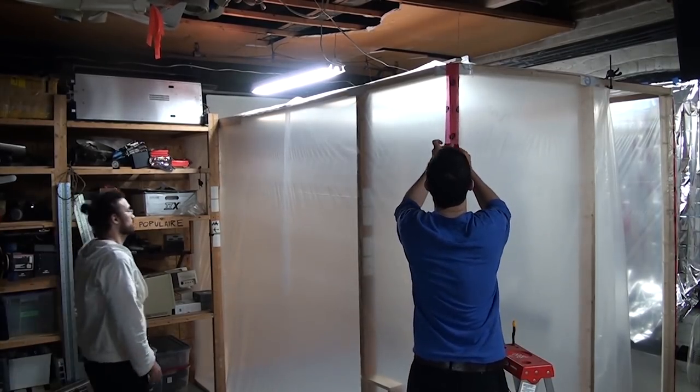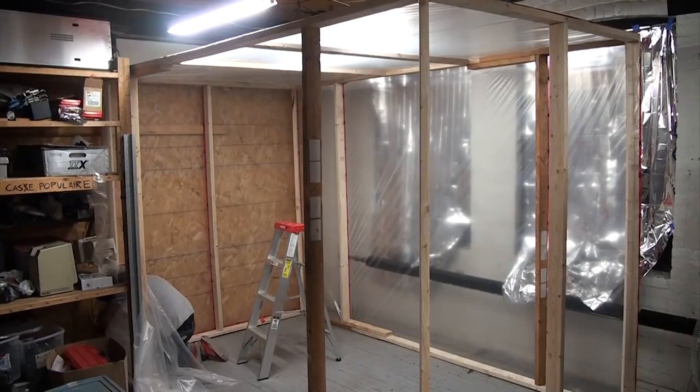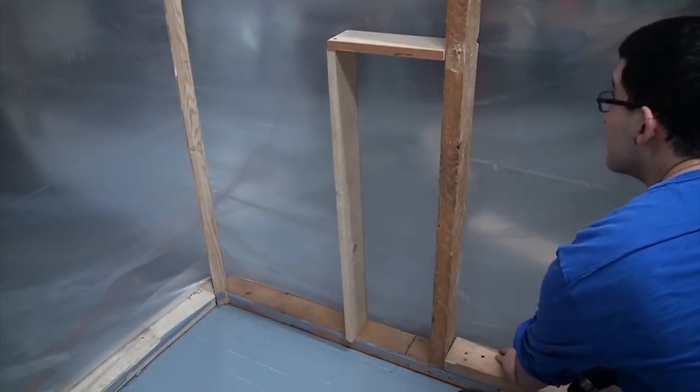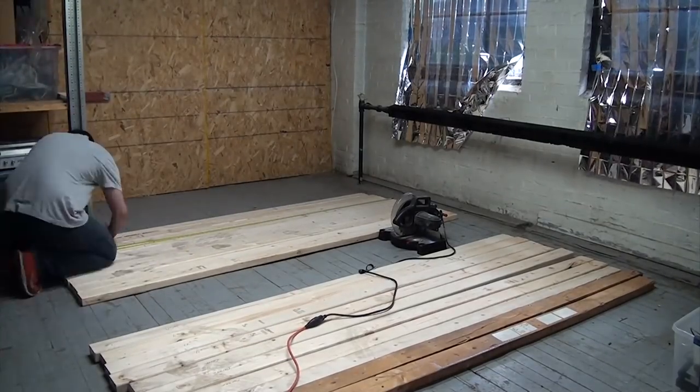However, we aren't going to build this in the standard way that you would, say, frame a house. Because we need to affix plastic to both sides, we need flat surfaces to attach the plastic to. So where the corners of the walls meet, the beams are cut at 45 degree angles, and a 2x4 is sandwiched between them.